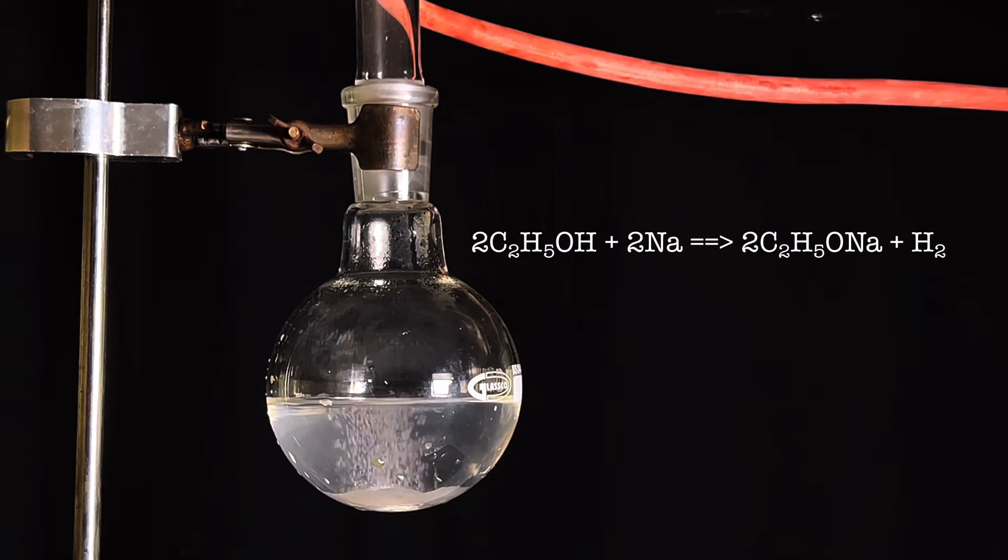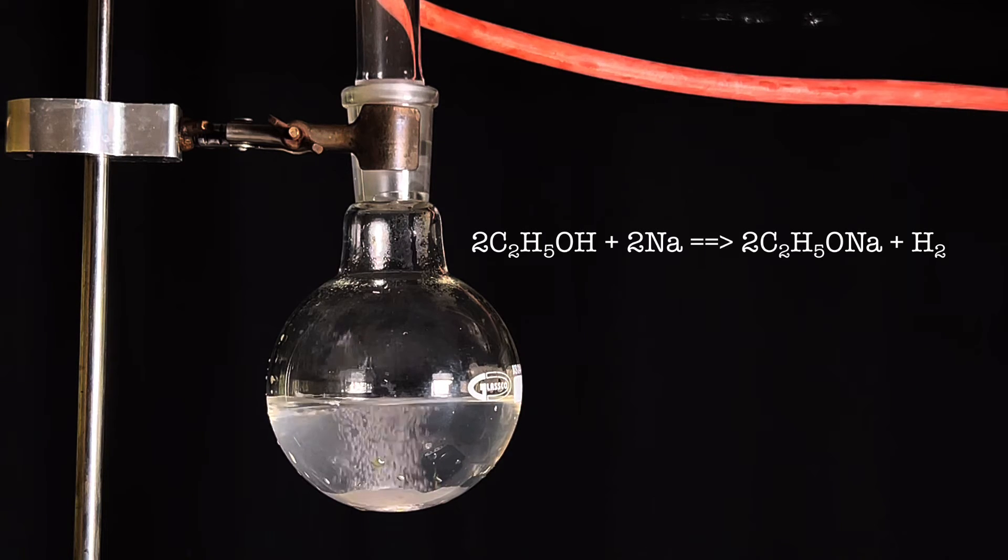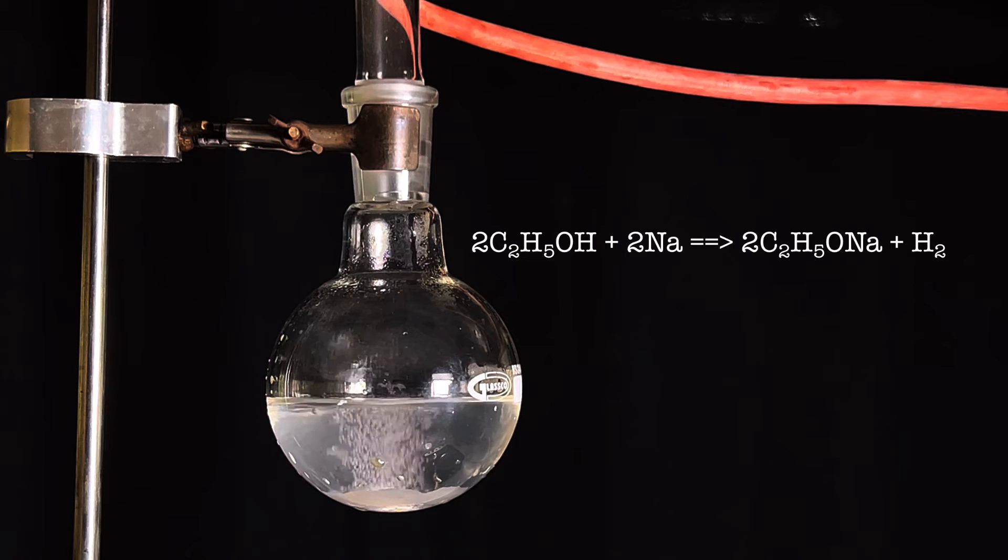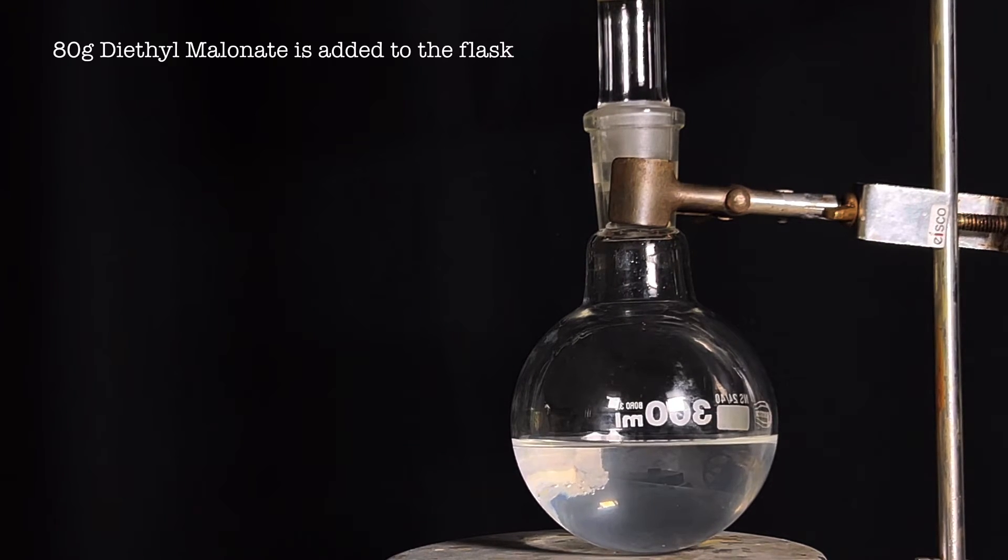What is happening here is the reaction of sodium metal with ethanol forming sodium ethoxide, with hydrogen gas released as a byproduct.